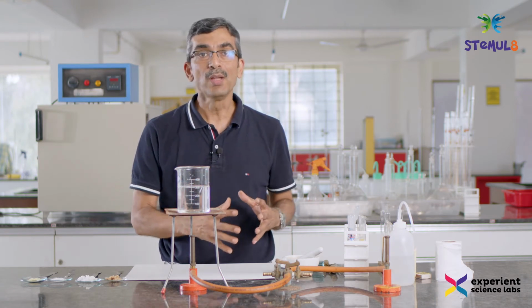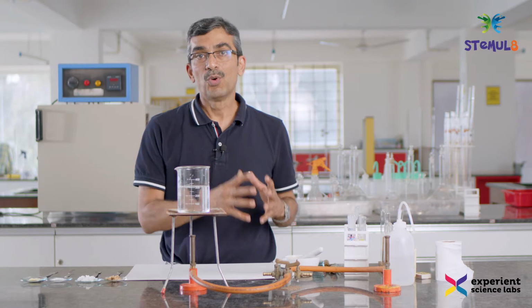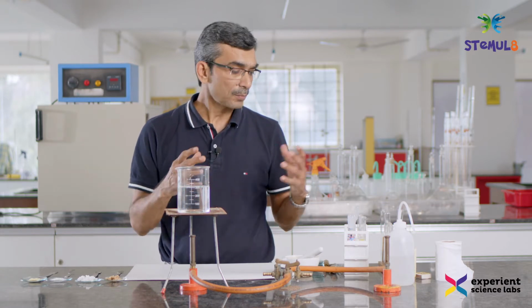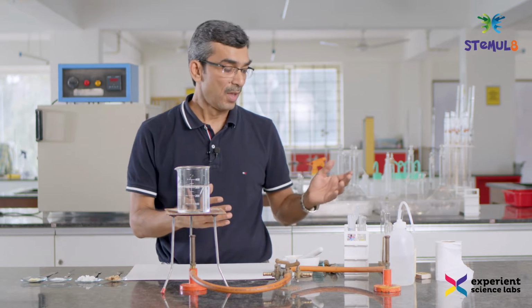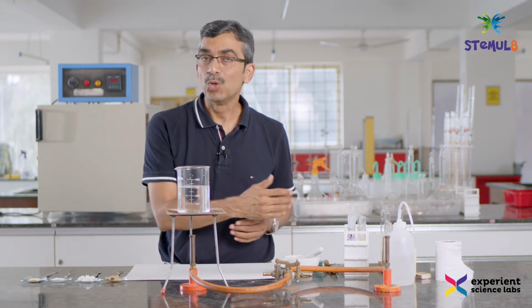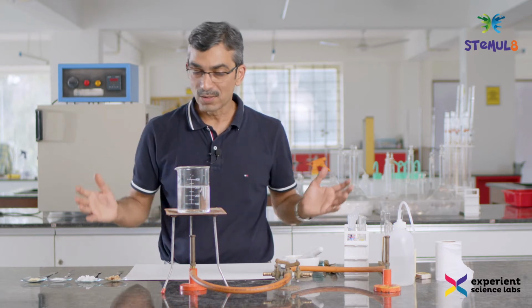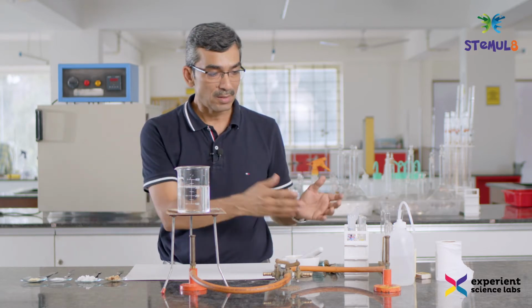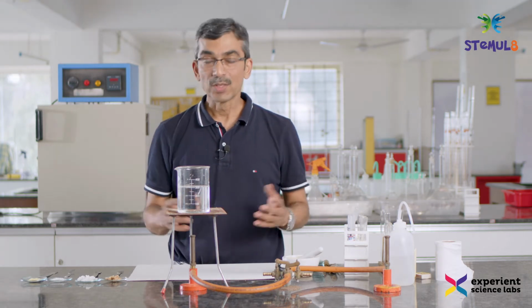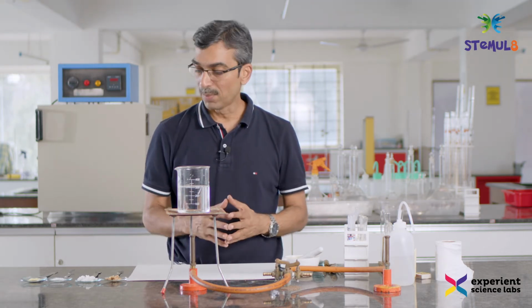We are just going to look at whether a particular nutrient is present or not present in the given food. And how do we do this? We have a set of reagents that we are going to use. So I will discuss the setup, and then I will talk about the reagents that we are going to use today. Okay, so let me talk about the setup.